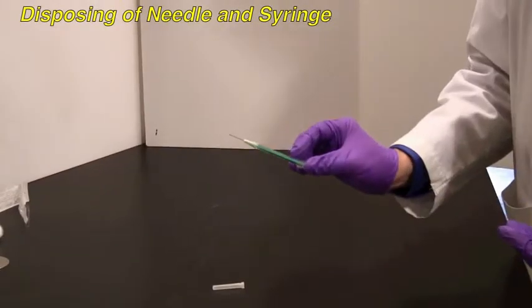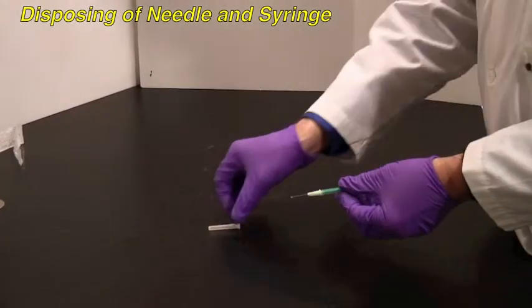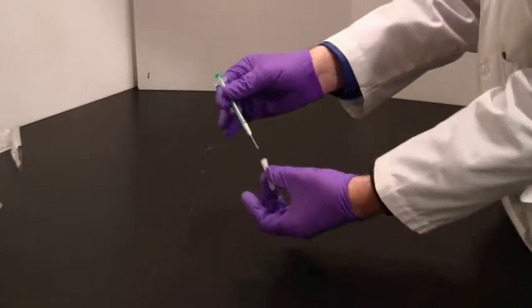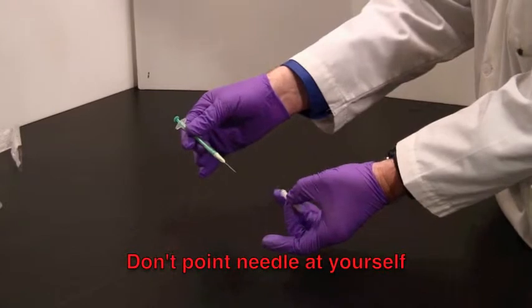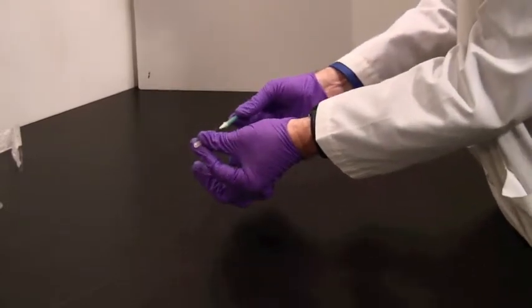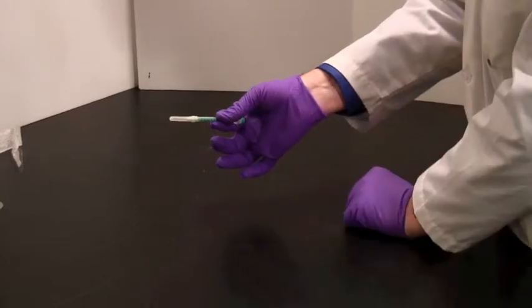When you have finished using your syringe setup, you should cover the needle. Now, be careful. Don't hold it like this. I'm pointing that needle at my hand. It's a great way to stab myself. Instead, hold it this way, so I'm pointing the needle away from myself. Put the cap back on.